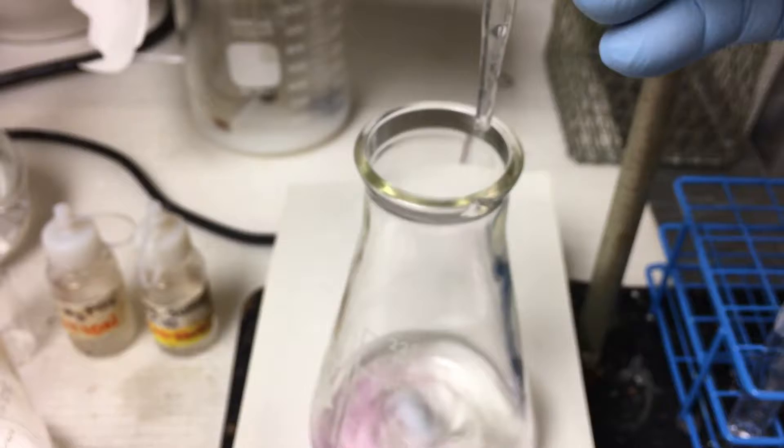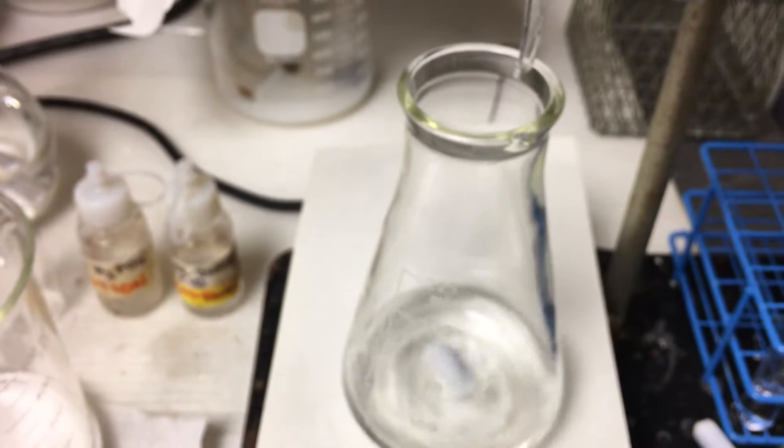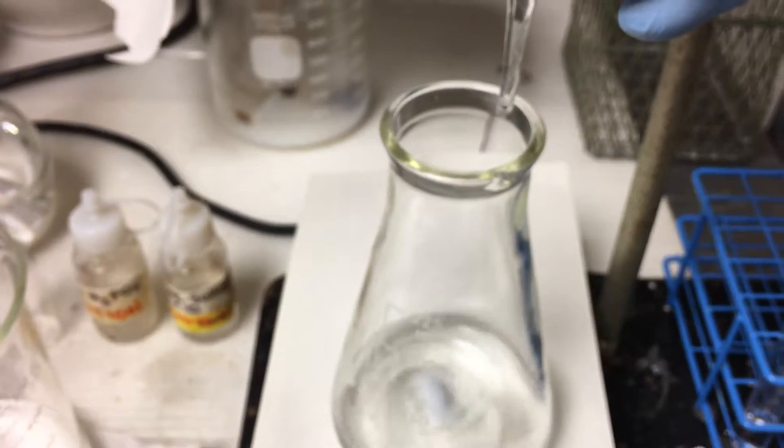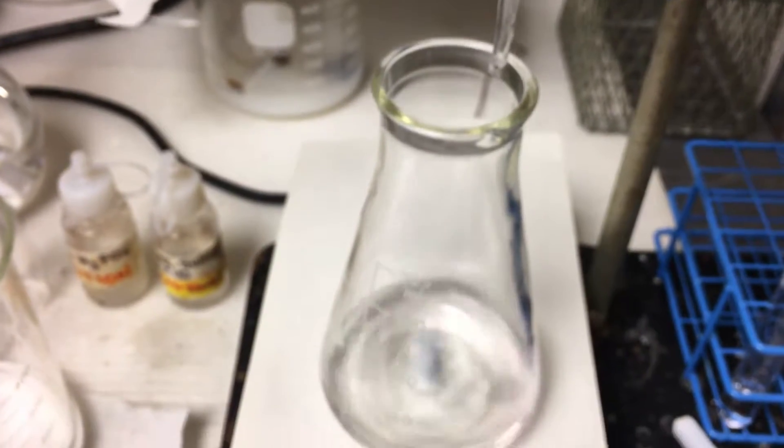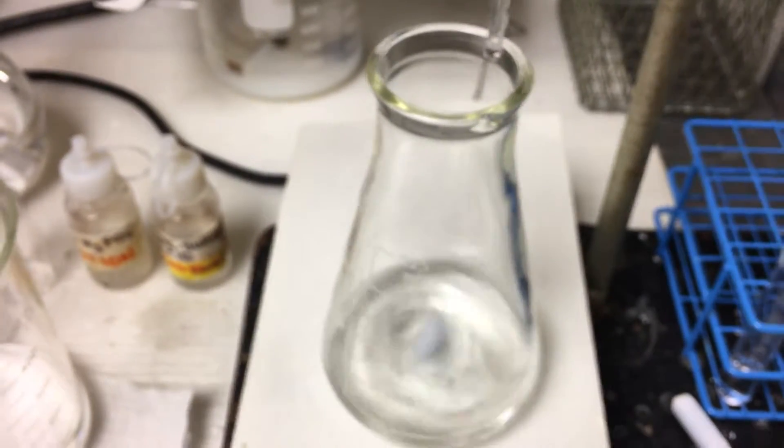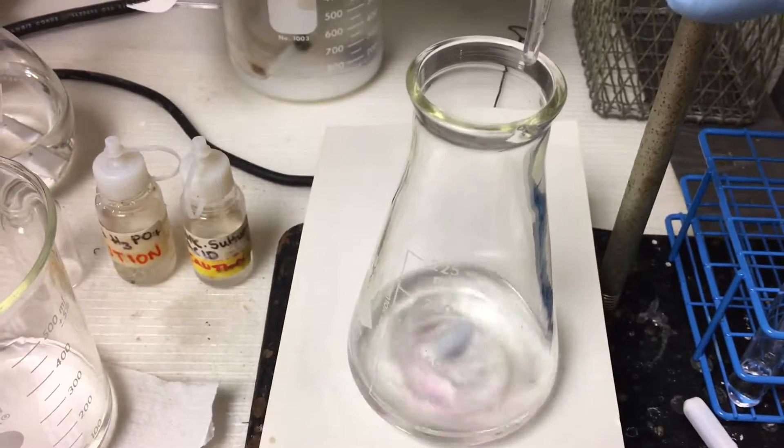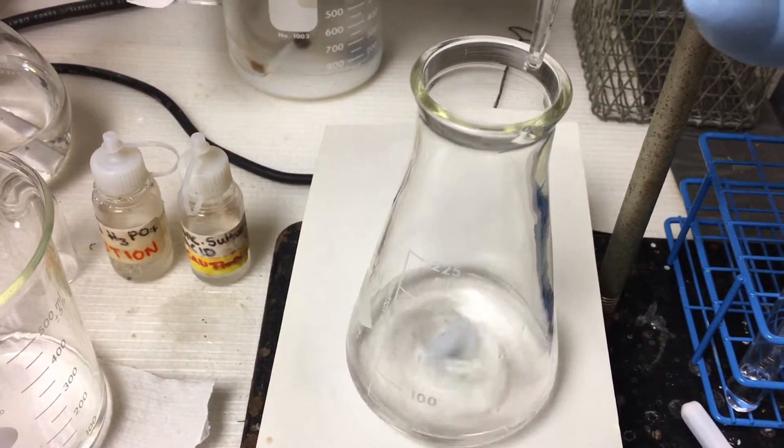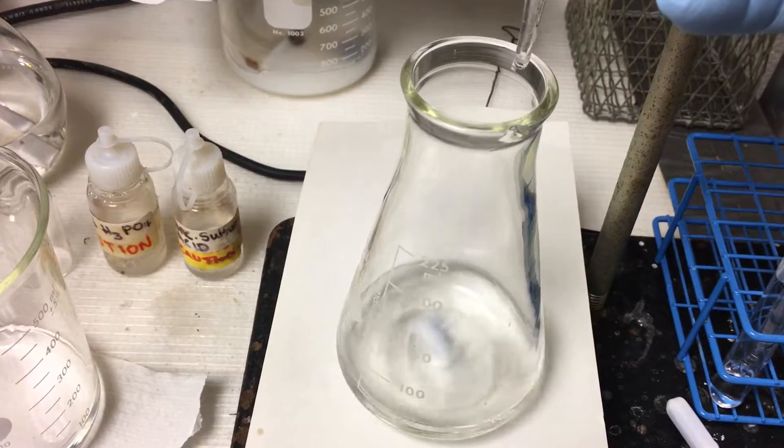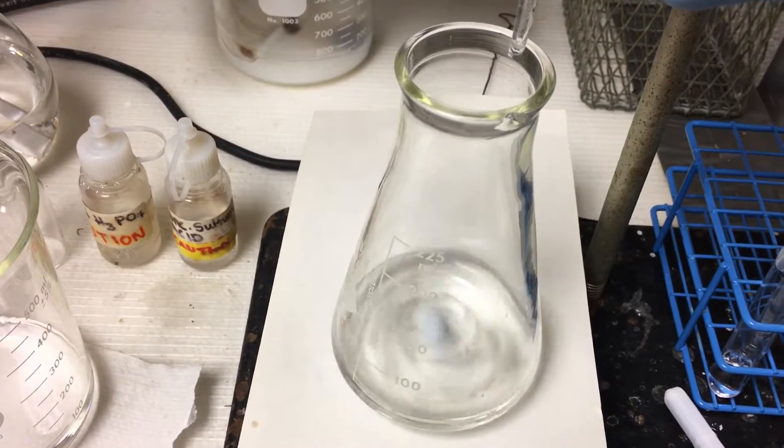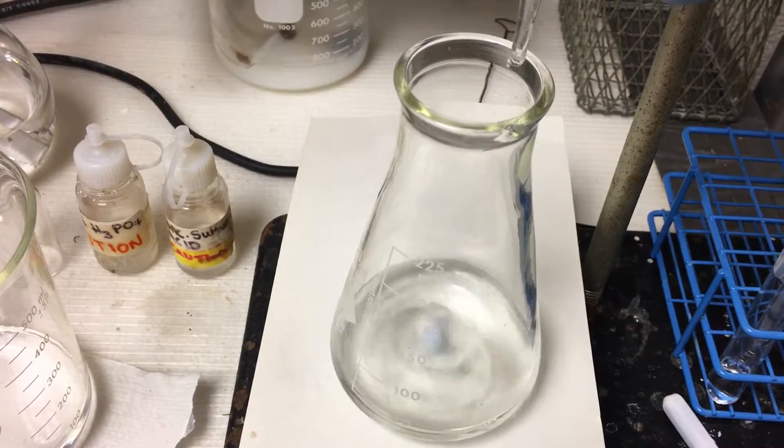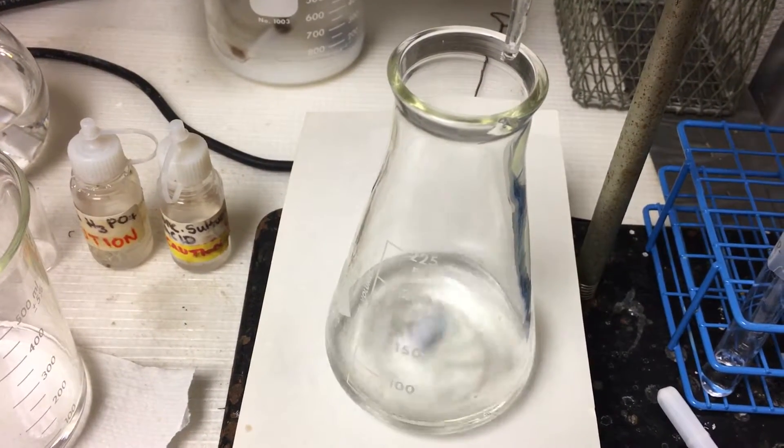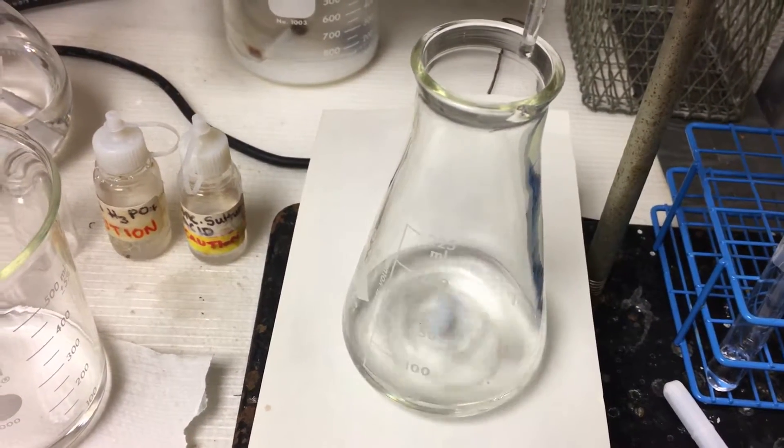Just a drop. Oops, solid. One, two... hold it. Maybe I don't know. Just one drop, it's gonna change. Okay, just a little bit.